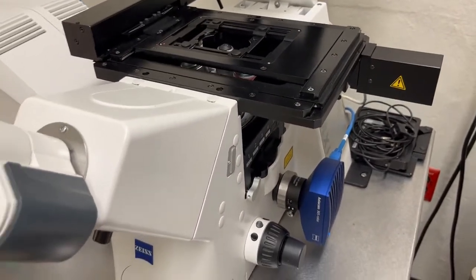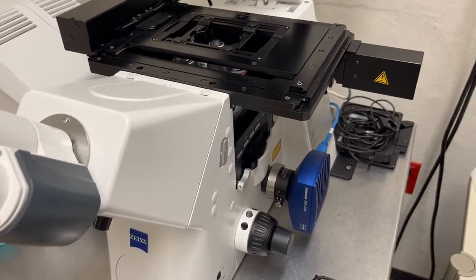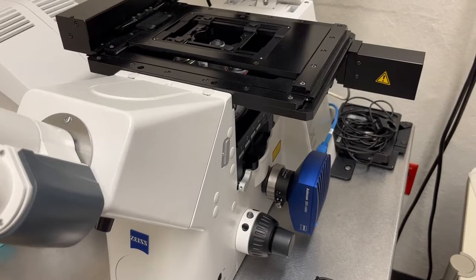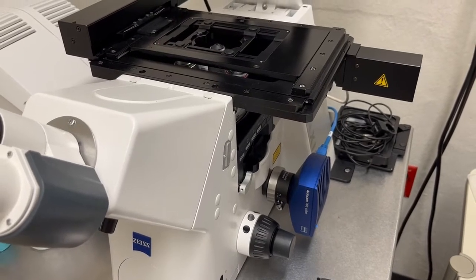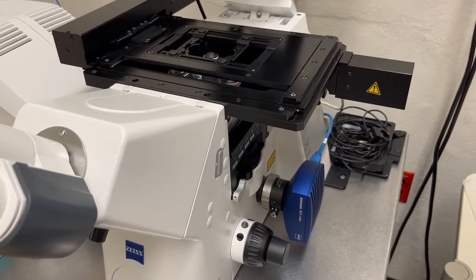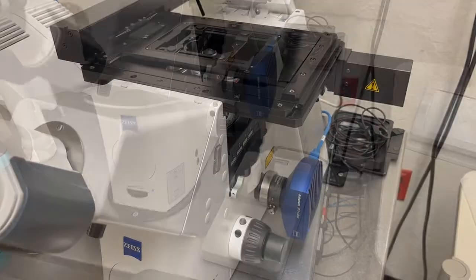So keep that in mind because it's exactly flipped from the Japanese manufacturers, Nikon and Olympus. So that's how you change focus on this system.